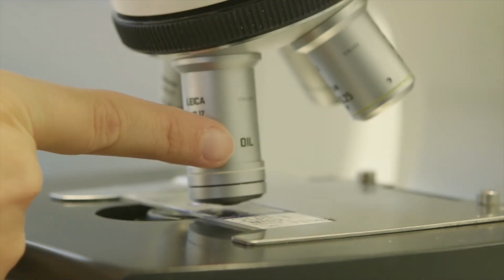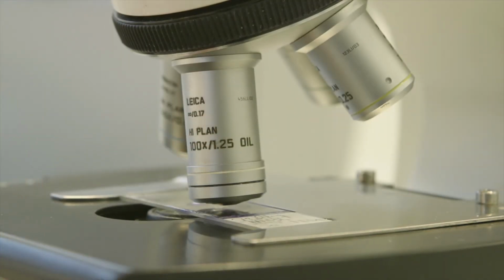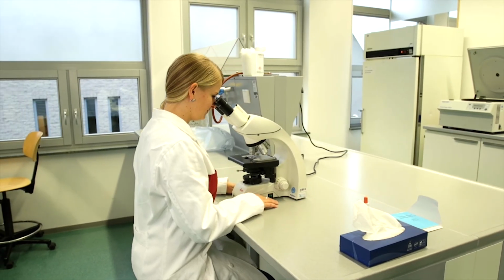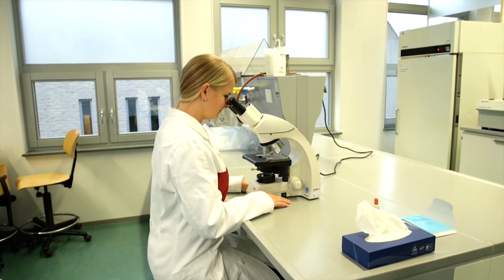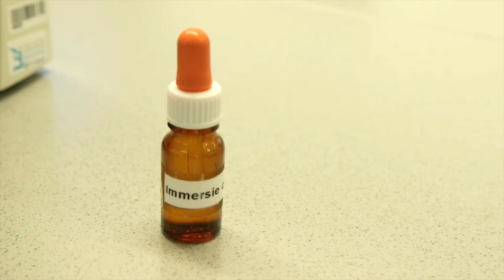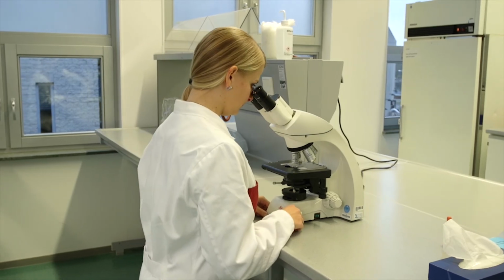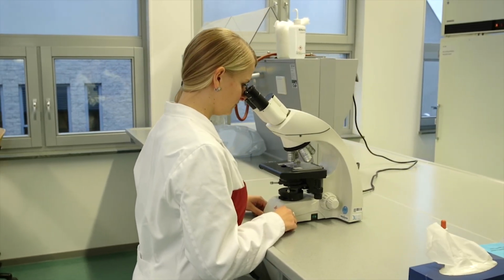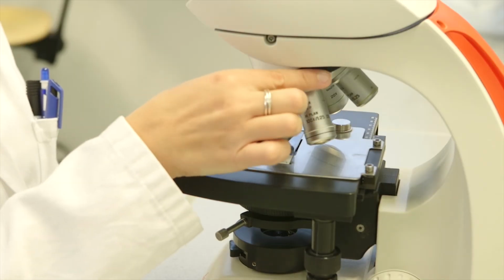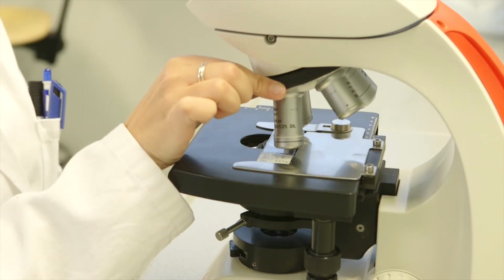Most microscopes also have a 100 times objective lens. This lens is often used in microbiology to look at bacteria, for example. In the space between the slide and the objective lens, light is refracted, scattered, and effectively lost. This makes it difficult to get a clear image. To solve this problem, we use oil between the slide and the objective because it has a similar light refractive index to glass. Please note that the immersion oil is hazardous, so use it sparingly and clean all traces of oil from the microscope and lens after use.